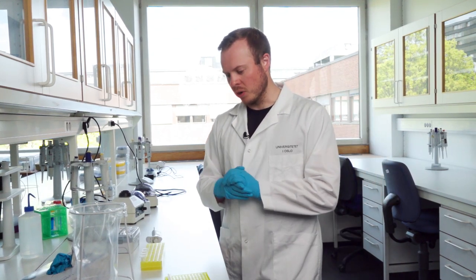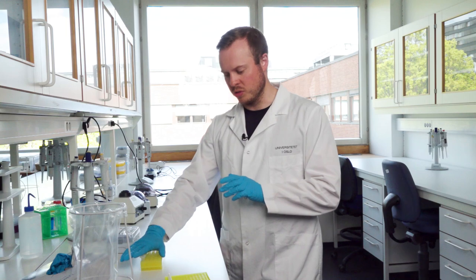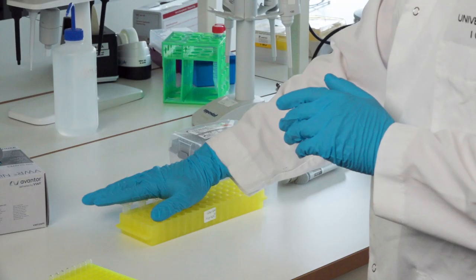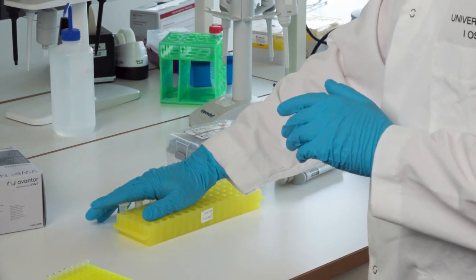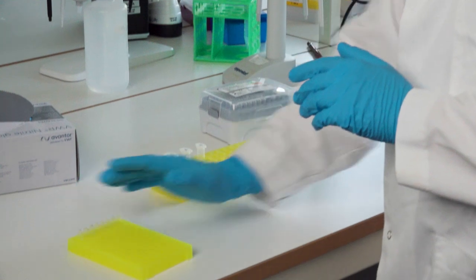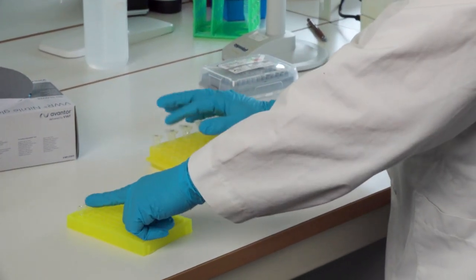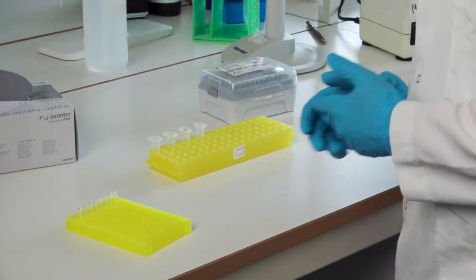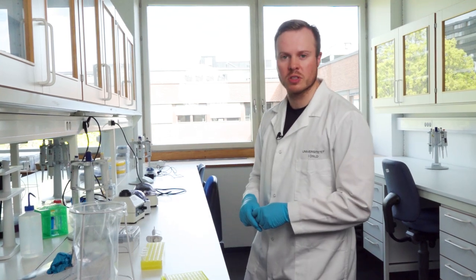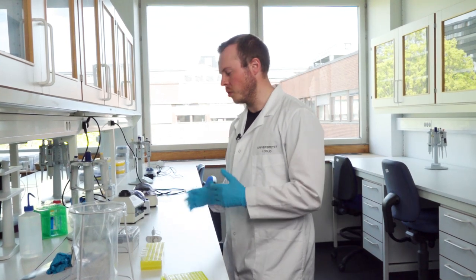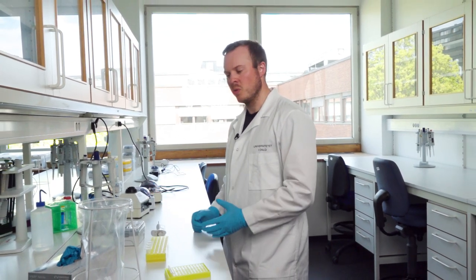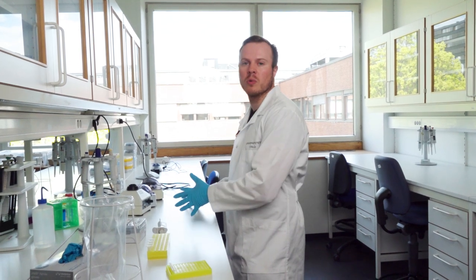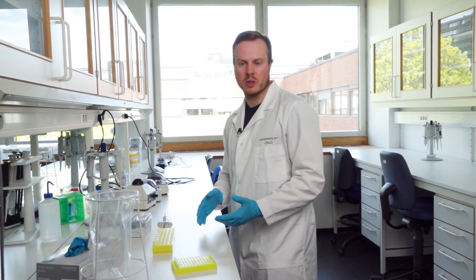Here we are going to add the samples of the PCR-1 product that is cleaned to the PCR tubes, and I have marked them with corresponding numbers so I know which sample goes where. It's also beneficial to bring your computer or whatever format you have to keep track of all the samples, especially when you have quite a lot of samples.